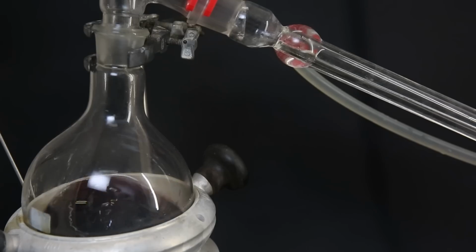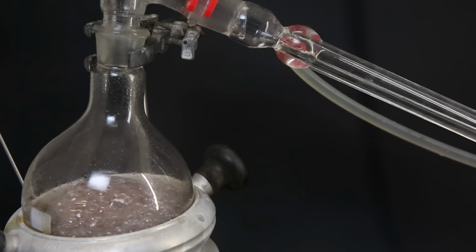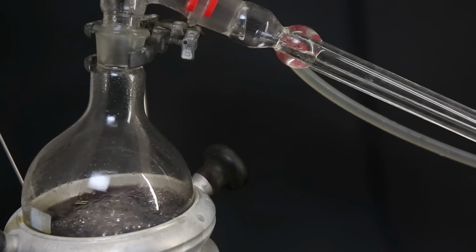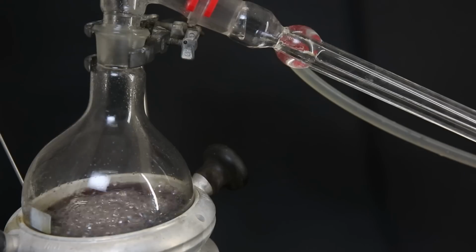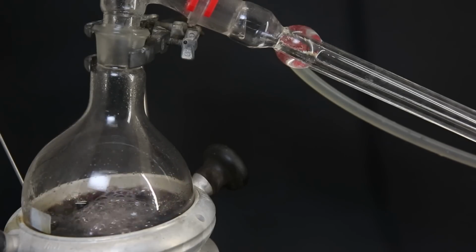So now I poured the mixture into a different flask and I changed the setup to a vacuum distillation. The mixture has turned even darker due to contact with the air. Since the enamine is so unstable, it oxidizes quickly, but since I likely have a decent amount, it shouldn't matter too much. Because I don't want this oxidation product during the next step, I will have to completely boil over everything until the flask is dry.